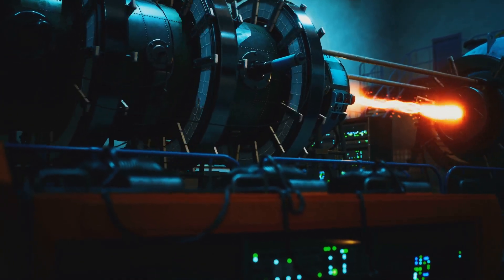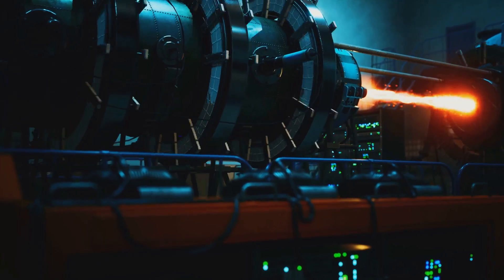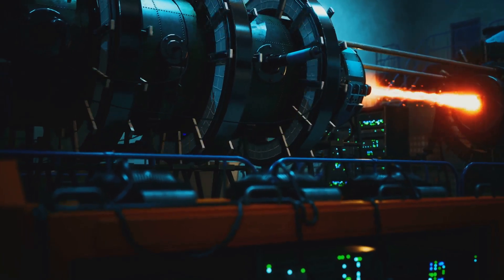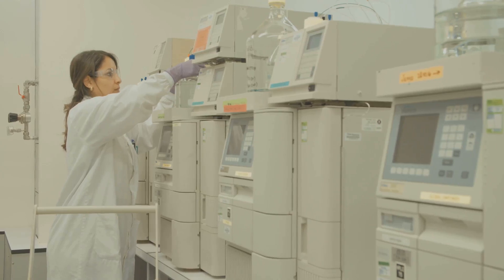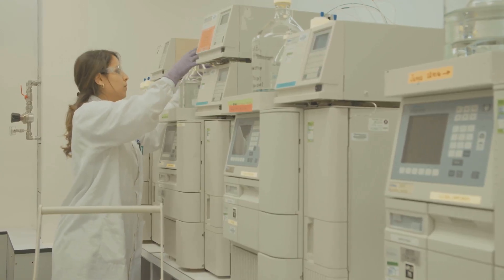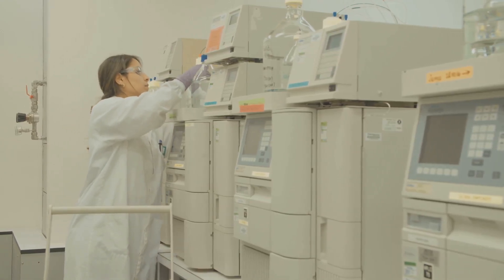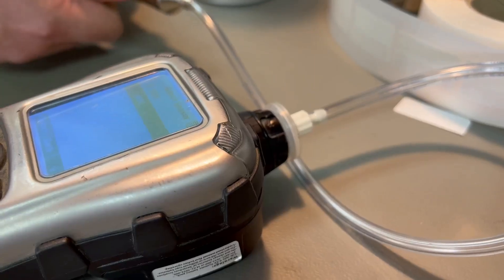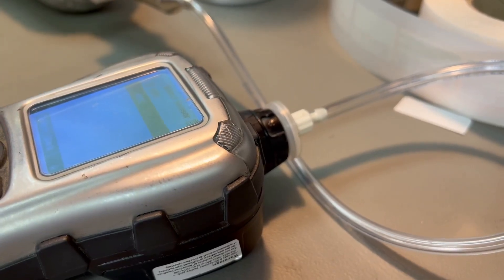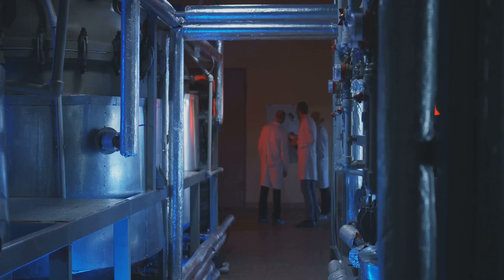The UV lamp in a PID is crucial for ionisation, with different lamps emitting various energy levels. Matching the lamp's energy to the VOCs is essential for effective detection. Most PIDs offer interchangeable lamps, allowing customisation for specific tasks.